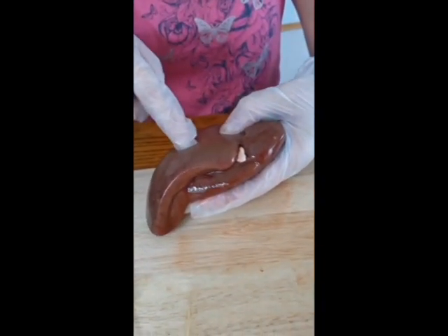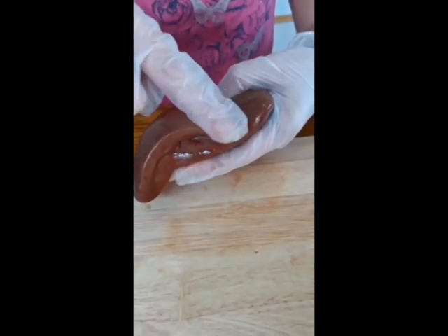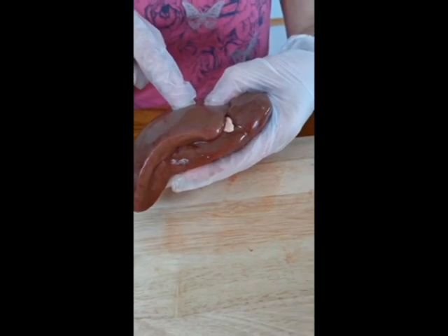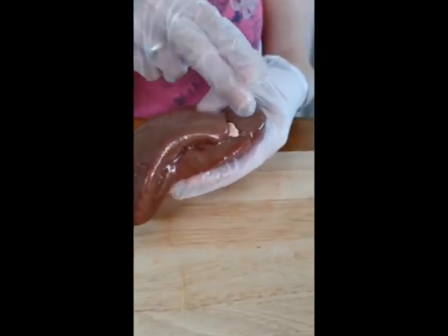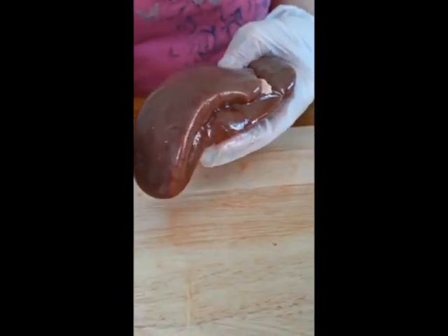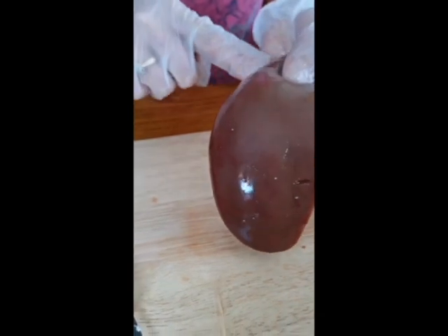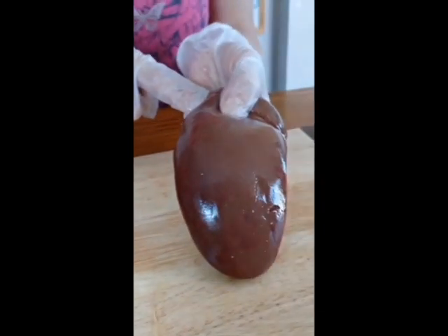So the kidney filters the blood and produces the urine, and it comes out the ureter and then goes into the bladder. You've got 2 kidneys, so you've got one either side with the bladder in the middle, and then when the bladder's full, you get the urge to go for a wee. So I'm just going to stop the video for a second so that I can dissect it open for you, and I'll show you what's inside.